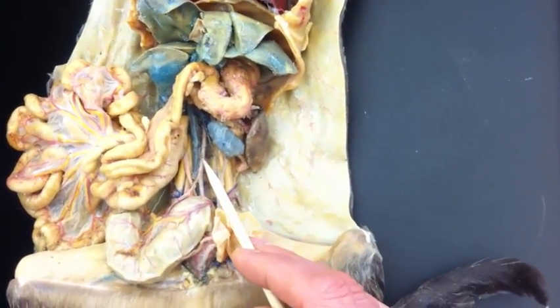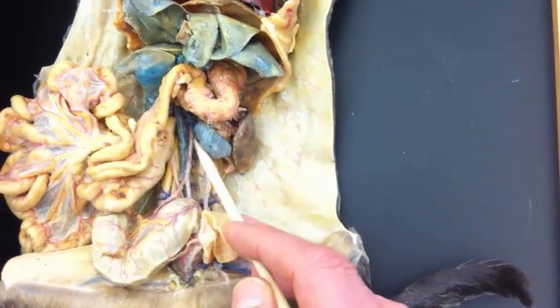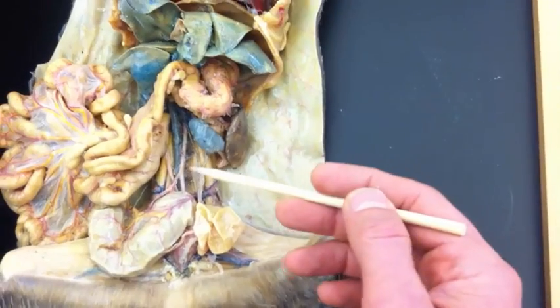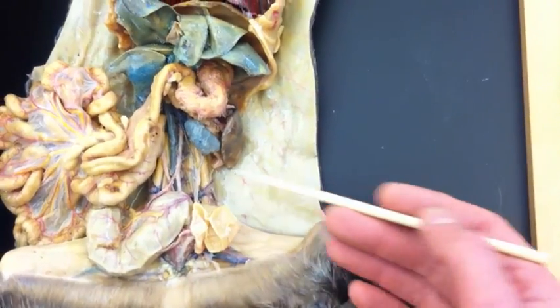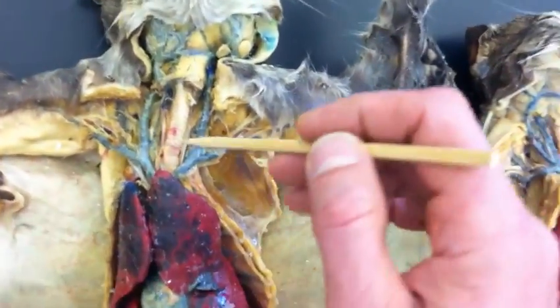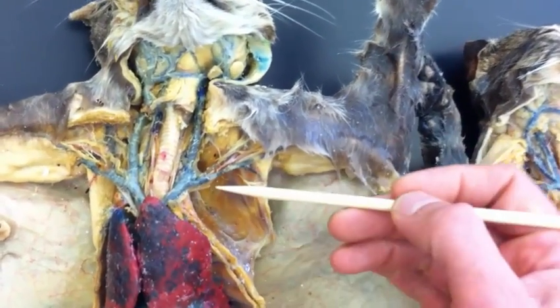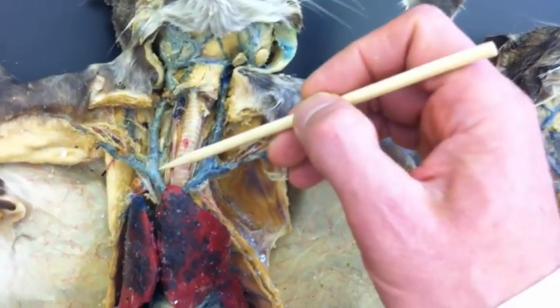And this is the abdominal aorta coming down. And in this particular cat, we're not low enough. There's other organs in the way in order to see the iliacs, but there might be another cat that has them. Let's go on to this next cat. Same again up here. And this cat's anatomy is about the same. The lungs are in the way for some of the stuff, but let's play.